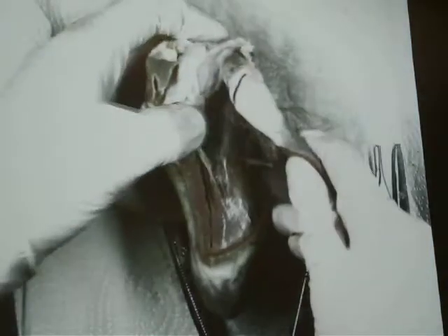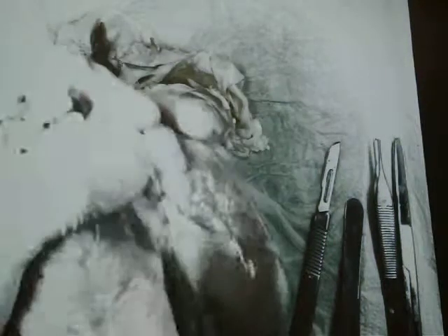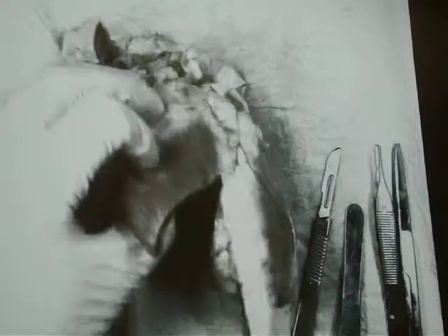Here's one. From the orientation I'm going to guess cranial. Let me look around a little bit more and see if I can find the other one. We have so much good fat in here. Now there's one more big major vessel we need to identify — which one is that? The pulmonary artery. To find that we're going to have to curl around — remember that line? It curls around and we actually cut it in half when we cut the artery. I'm going to tuck my finger through the pulmonary artery. I think I'm going to have to call 9-1-1 and tell them I have an instructor with their fingers stuck in the heart. That would be ugly.